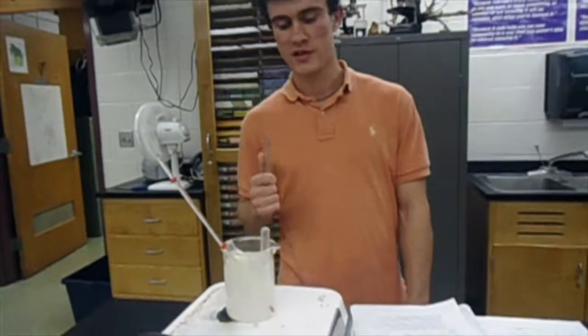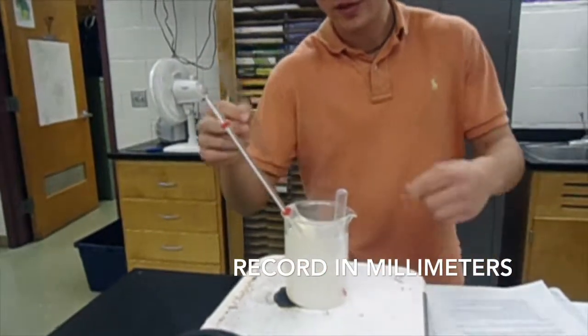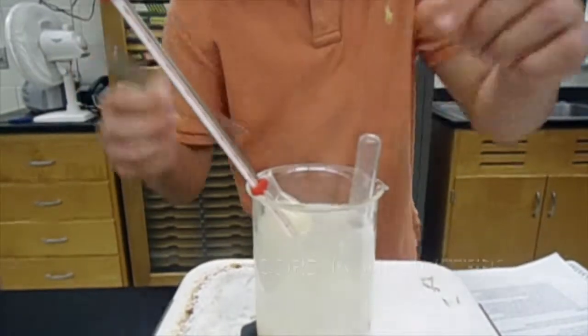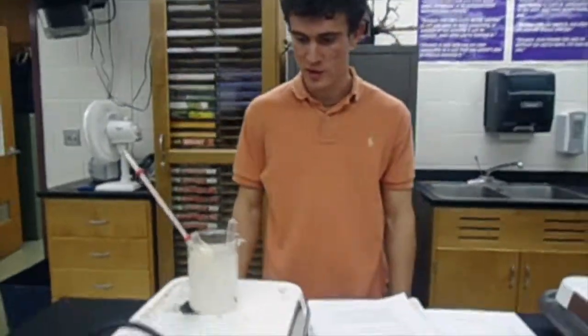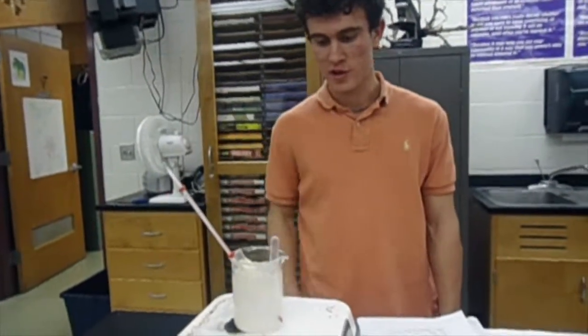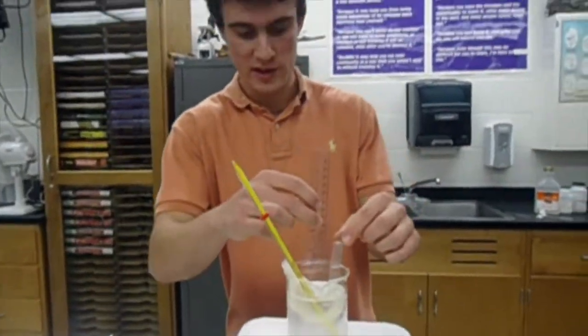Every 5 minutes, and it's been 5 minutes now, you're going to measure the carbon dioxide buildup. This is kind of tricky because it's kind of covered in water. Basically, the enzymes work very quickly, and that fermentation tube is all the way down. So cellular respiration occurred very quickly in the hot one, as we predicted.